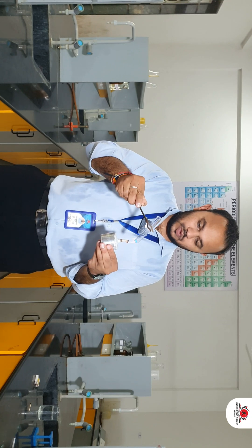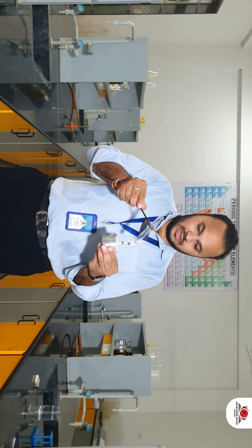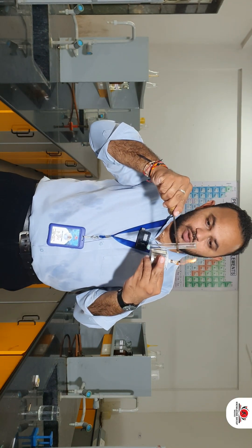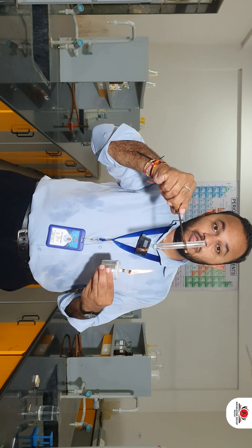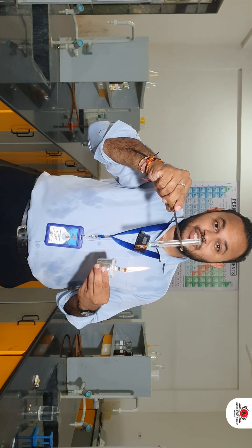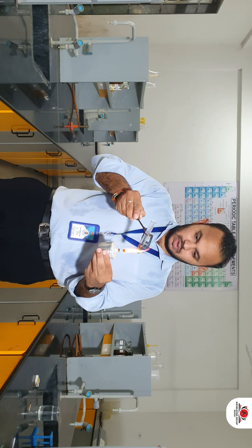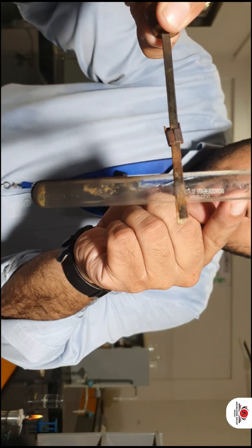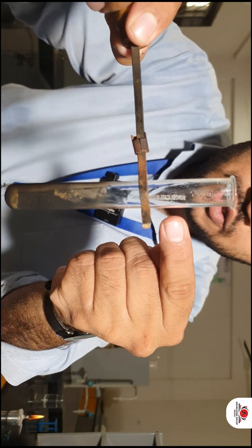When I heat the copper sulfate crystals, you can see that there are water molecules present at the surface of the test tube. These are the water molecules which were present in the copper sulfate salt in the form of water of crystallization, as you can see at the surface of the test tube.